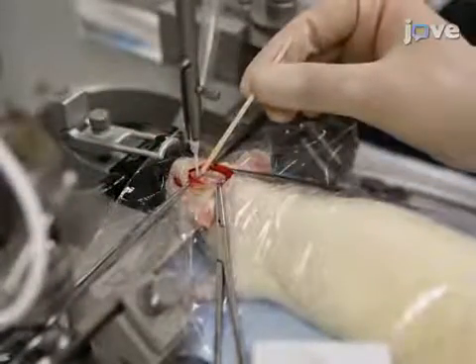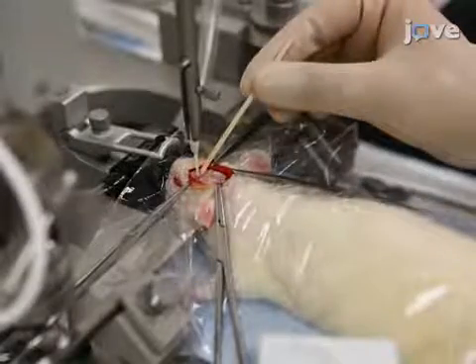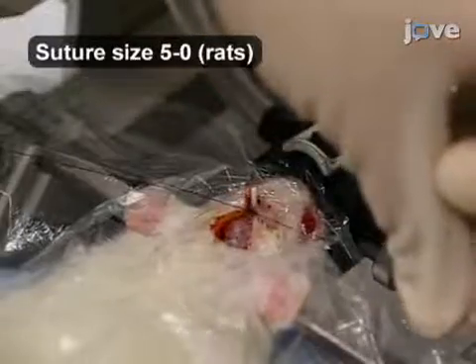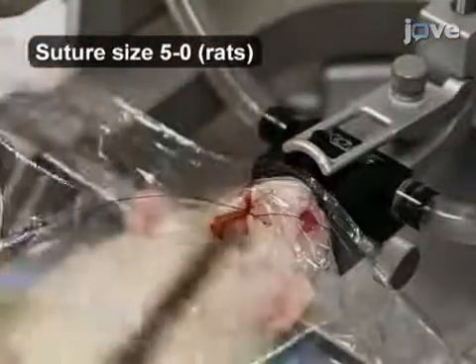Finally, mount the ferrule implant to the skull using dental cement. After the dental cement has solidified, seal the incision with sutures around the dental cement cap.